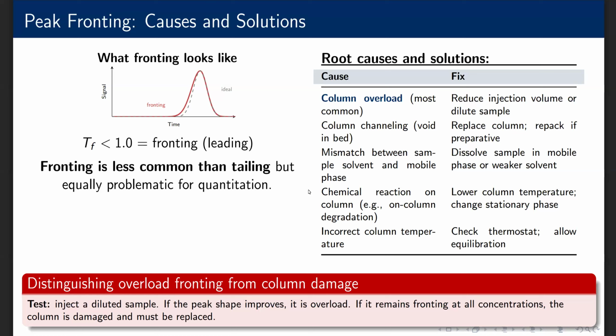Solvent mismatch is another common fronting cause. If the sample is dissolved in a solvent much stronger than the mobile phase, the analyte band spreads at the point of injection before refocusing, creating a front shoulder. The solution is to dissolve the sample in mobile phase or a weaker solvent.